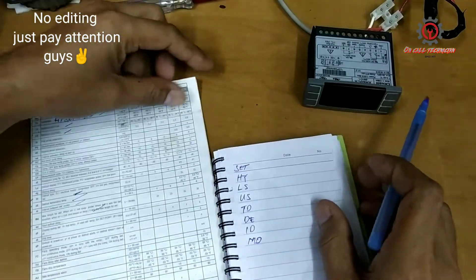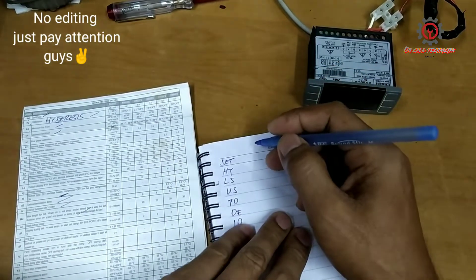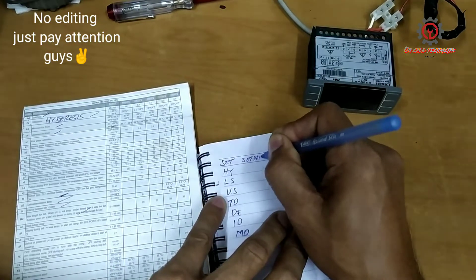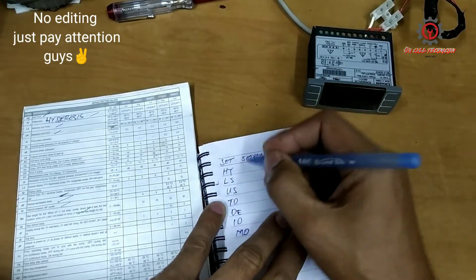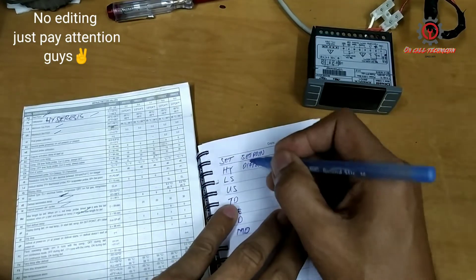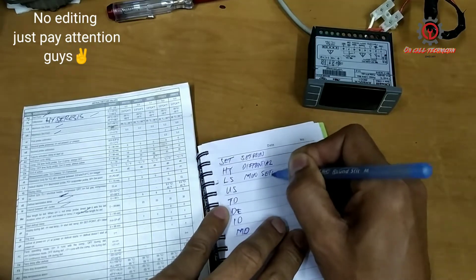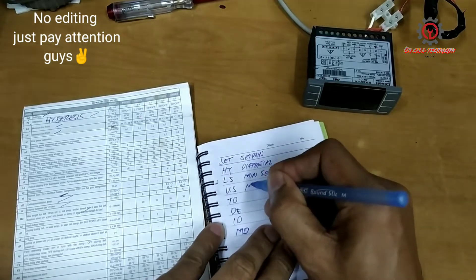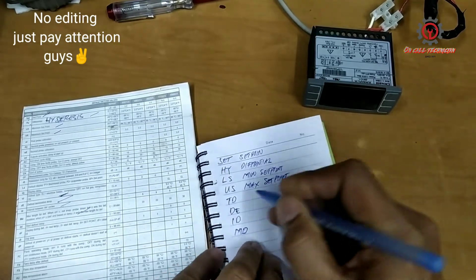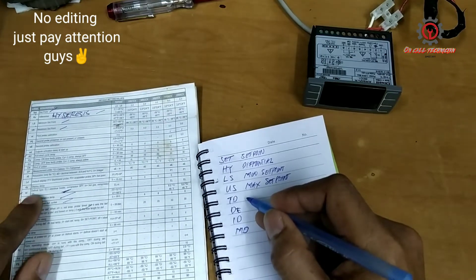Let's take all the defaults here. SET is the set point, HY is the differential, LS is the minimum set point, US is the maximum set point, and TD stands for defrosting type.